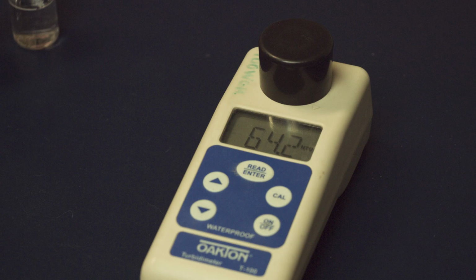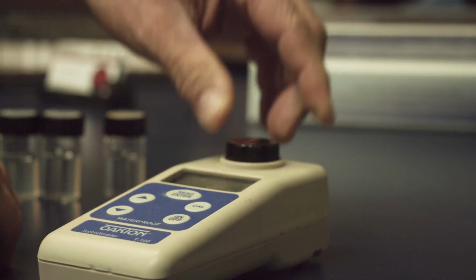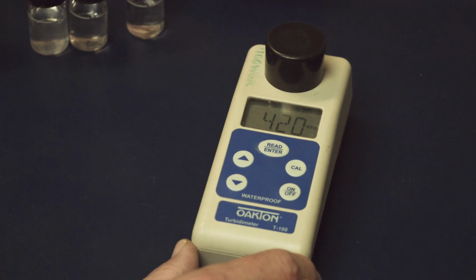So what happened with that 64.2 reading? Was there a technical malfunction, or had we found some revolutionary new substance? Just to be sure, we decided to let the sample sit for a bit longer. Our reading started to drop quite a bit. After 1 hour, it read 704. Another hour, and it read 420.